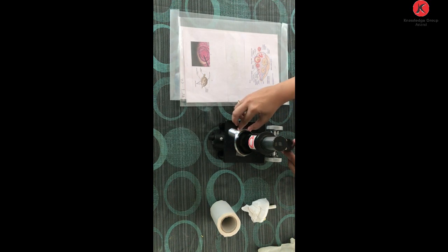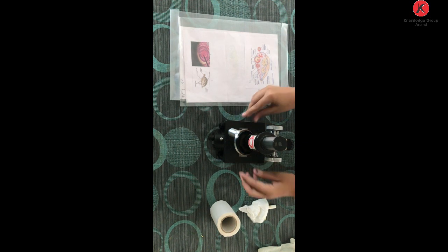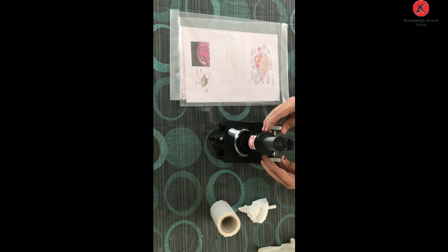Then, we already have a pre-prepared slide. So we have to place this slide in the microscope, with a cover slip on it which will already be present, as we have a permanent slide for observing the section of testis and the ovaries. So we will have to place it over here, right? We have to attach the clips, and then with the help of the fine and the coarse adjustment screw, we will adjust it in such a way that we can observe completely all the cells that are present in the seminiferous tubules as well as in the ovaries. There will be two particular slides given to you, and you have to observe them with the help of the microscope.